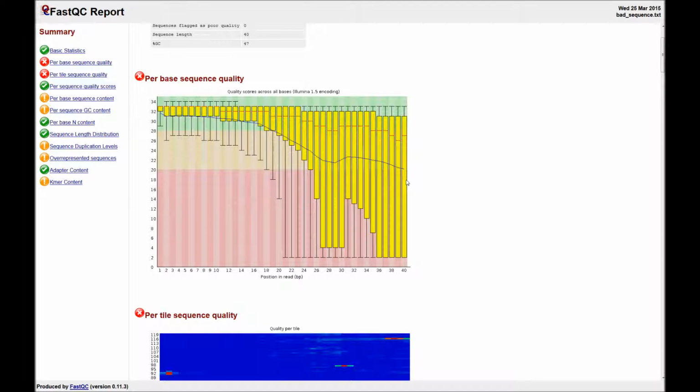Here is an example from the author's website that shows a set of poor sequences. So you can see that the Phred scores drop off at the end of the reads. However, as we will see in the trimming stage of the pipeline, it is possible to remove the reads that have the poor sequences, retaining a set of decent reads for the mapping step.